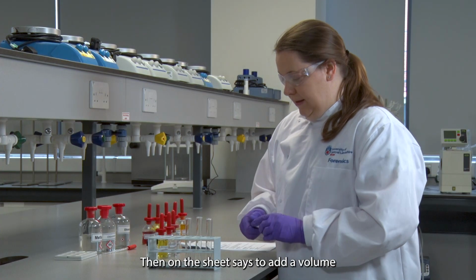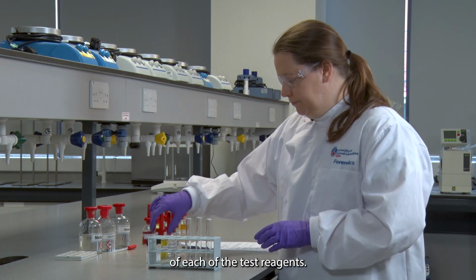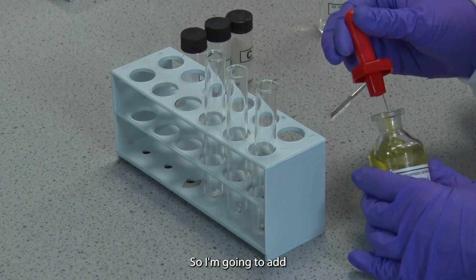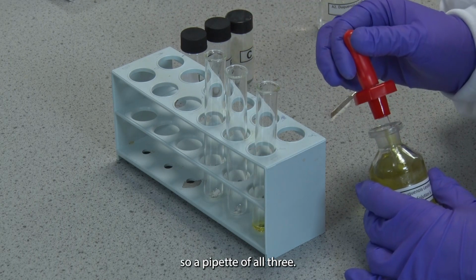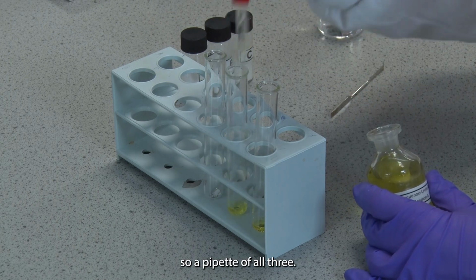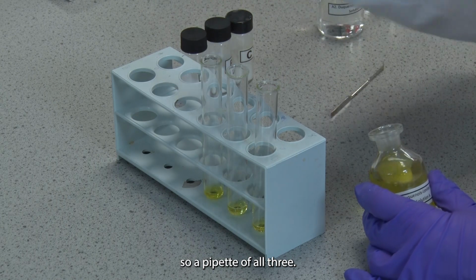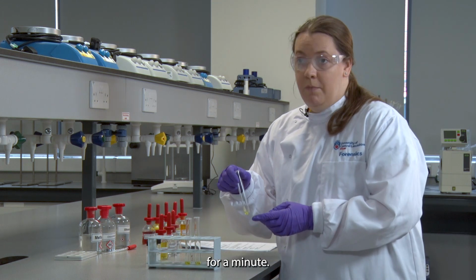Then on the sheet it says to add a volume of each of the test reagents. So I'm going to add the same amount, so it's a pipette of all three. And then you're going to shake this for a minute.